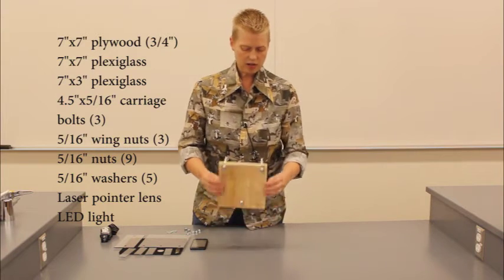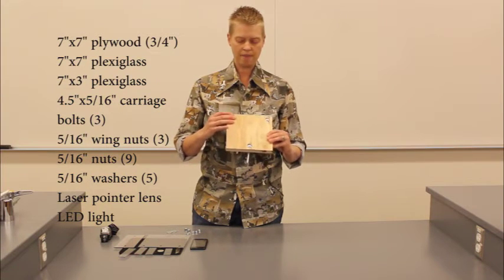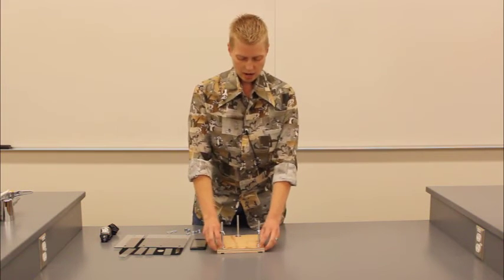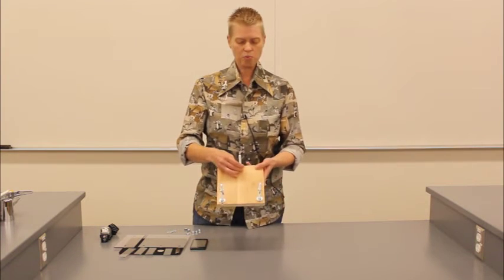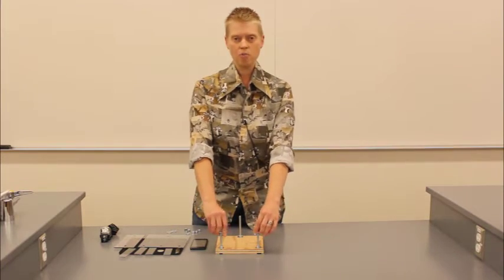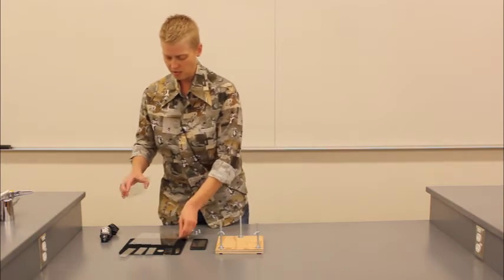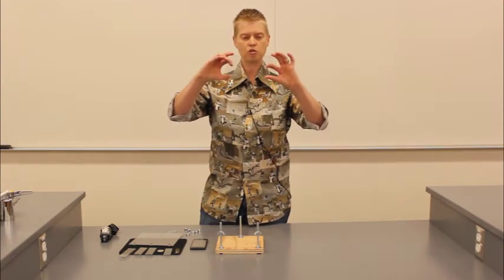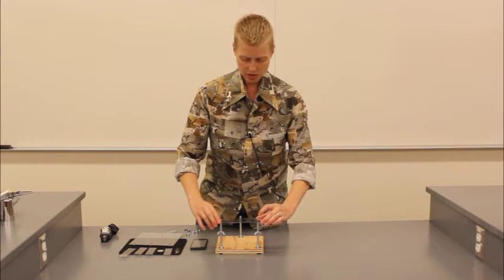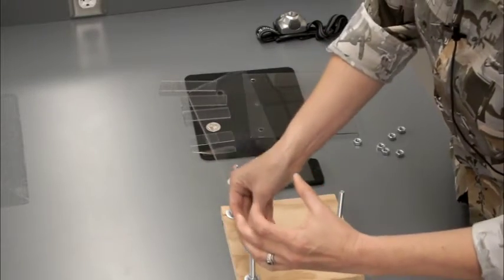So to put the microscope together, you're going to drill some holes, 3 of them in the bottom of your plywood. You're going to put your carriage bolts through, attach a couple washers and some nuts to secure those bolts so that they don't move anywhere. Put your 2 wing nuts on the 2 bolts in the front. Take your specimen stand. Once it's been drilled, you're going to drill 2 holes in it right here. Put the wing nuts on there. Those are going to support your specimen stand, in addition to a couple washers that go below it.